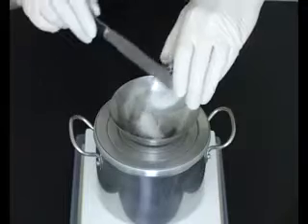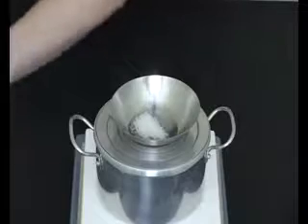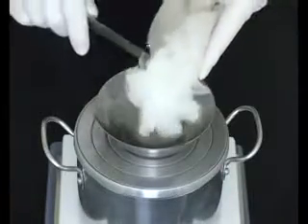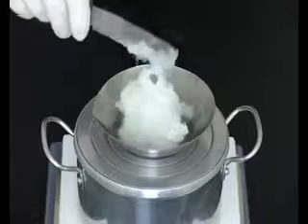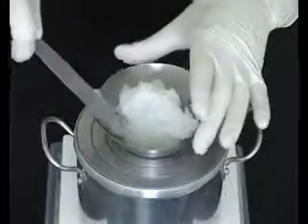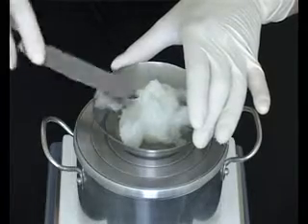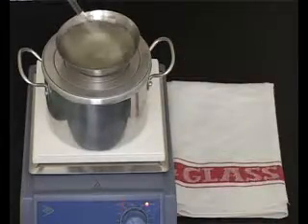Add the next ingredient and stir. Now add the ingredient with the next lowest melting point. Stir again to ensure even mixing. Once incorporated, remove the evaporating basin from the heat.